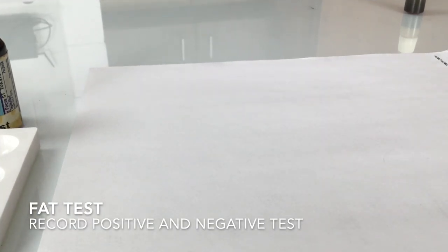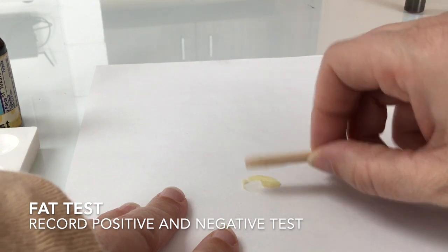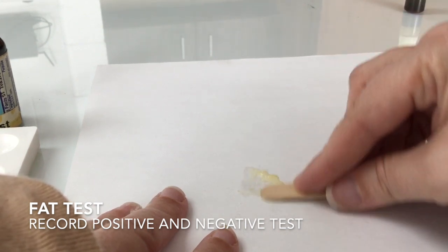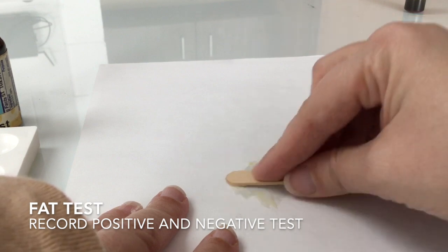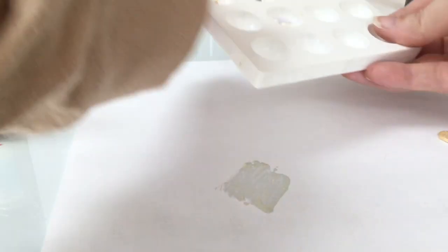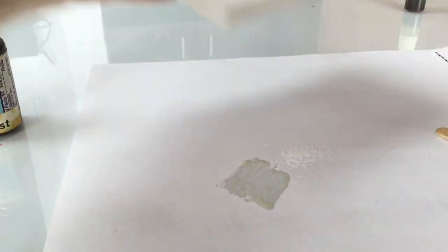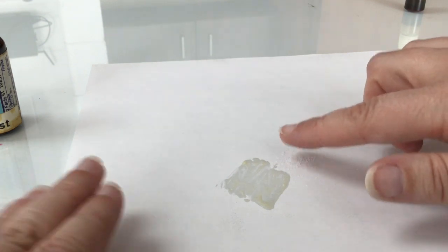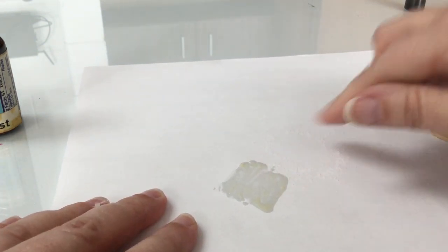For the fat test, we will take a small amount of margarine, which is mostly fat, and rub it into a piece of paper. And we can see that when we do that, the paper begins to look translucent. When we do the same test with salt, there is nothing absorbing into the paper, and so we don't see that translucence. So salt does not have fat.